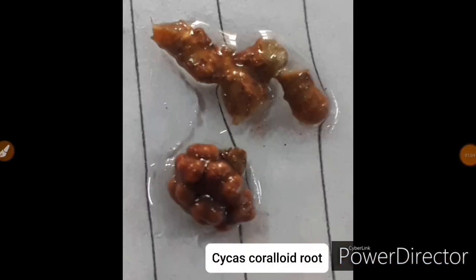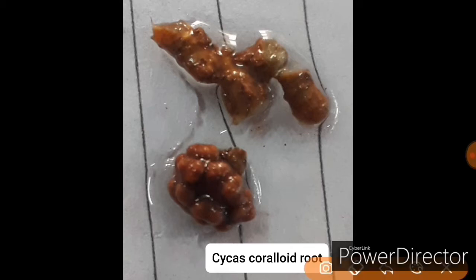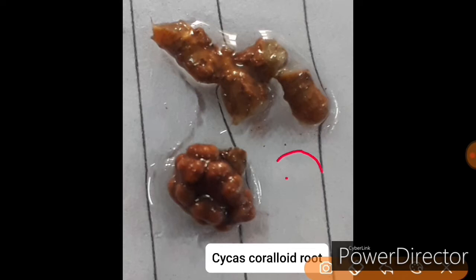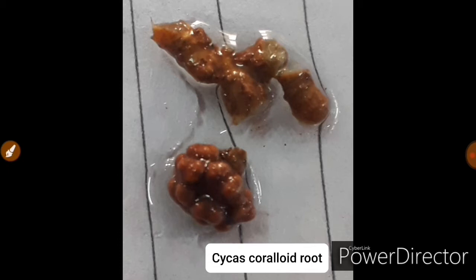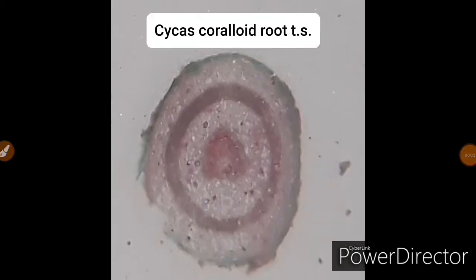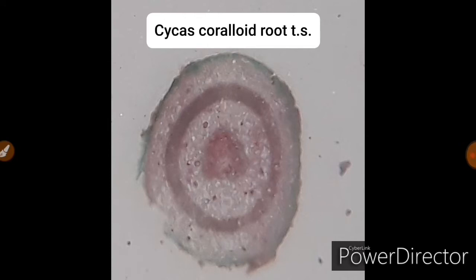The next one is the coralloid root. This is a section or portion of a coralloid root. As you can see, these are basically dichotomously branched and highly coiled structures that give the appearance of a coral. These are the coralloid roots of Cycas.